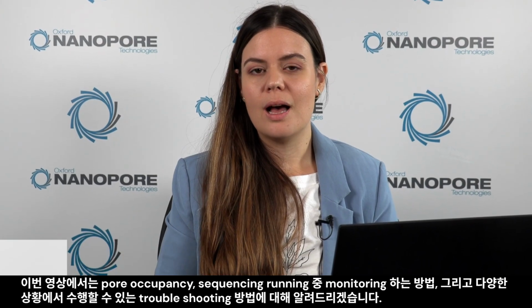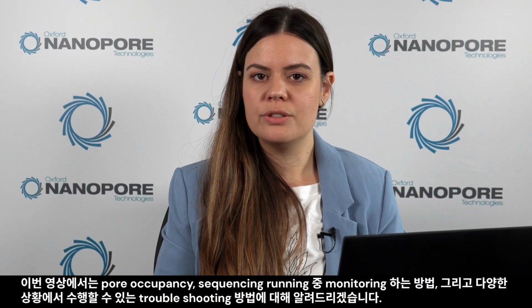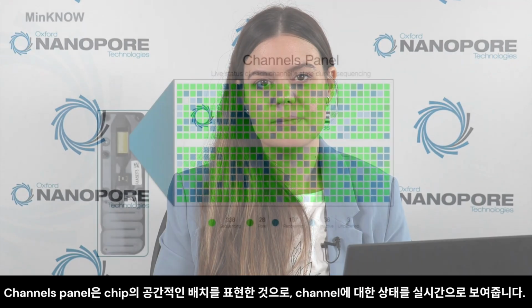In this video, I'm going to introduce you to the concept of pore occupancy, how to monitor this during your run, and how to troubleshoot for different scenarios.